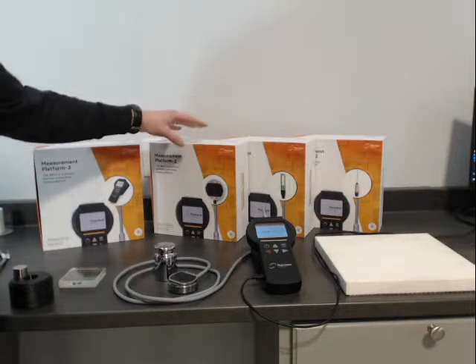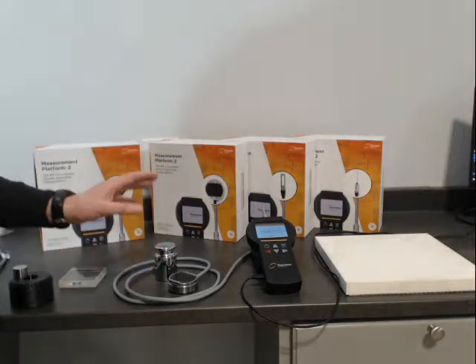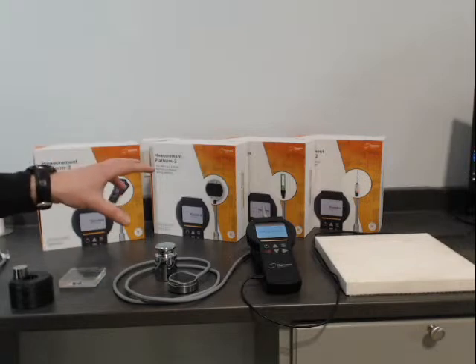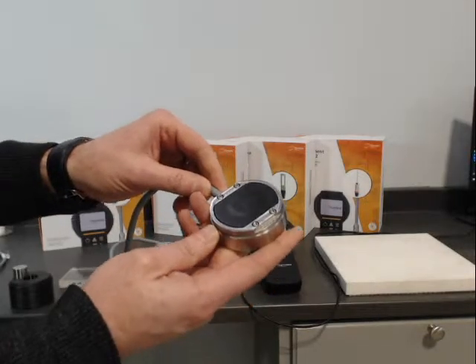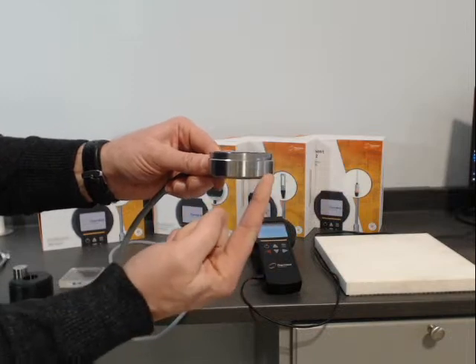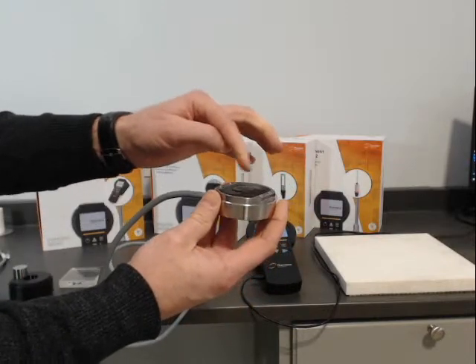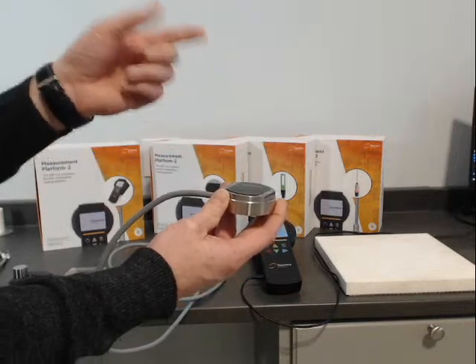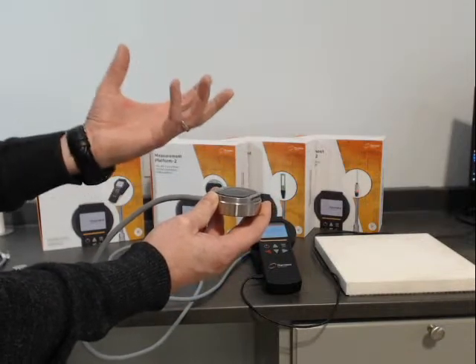It follows all the same measurement principles as the classic transient plane source, which is ISO 22007-2. That's the only difference. Because we have a limited range of conductivity, we really don't need the Wheatstone bridge — our sensitivity is quite good for measuring solids on this particular sensor. A close-up of this sensor: it's a permanent asymmetric or single-sided configuration. If you were to cross-section this, you would see a metal housing, and underneath you can see it's indented a little bit. That 12.8 mm sensor is permanently placed on top of XPS, which is big enough so that all the different transient times available — 10, 20, and 40 seconds — stay within the dimensions of the insulated backside.